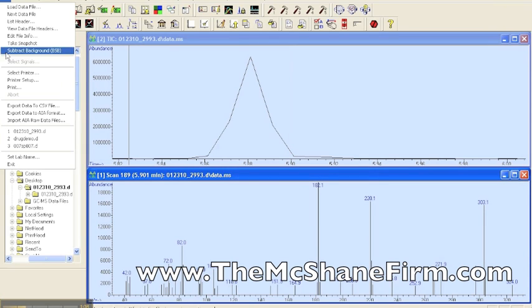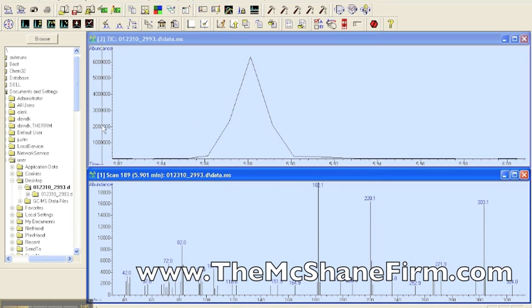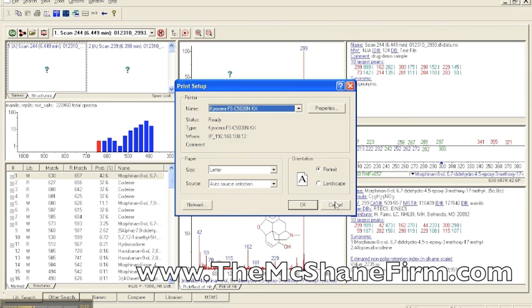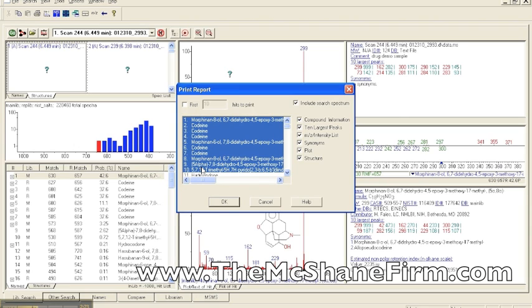So the first thing that you would do is you would hit print. And then you can see here, you can either do a selected window, the total ion chromatogram, the scan, the spectrum, the method itself. Those are different things that can be printed out. And of course, you can do different types of prints. You can export data to CSV files, so it's open in any Excel spreadsheet, AIA format. But also over here, when you do the NIST spectral library, if you do an auto report, you get one sheet of paper and not very much information. But if you go into the print report instead of the auto report, you can literally click and choose, and it'll print out all of the compound information, 10 largest peaks for each one of those, and that way you can do it.